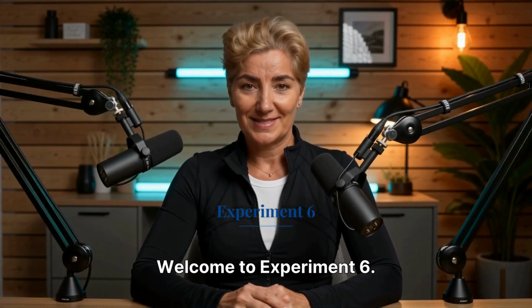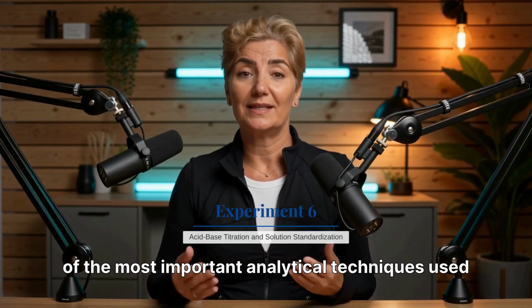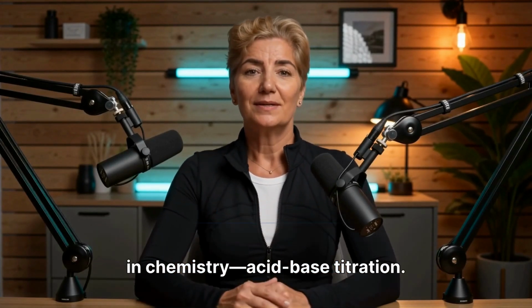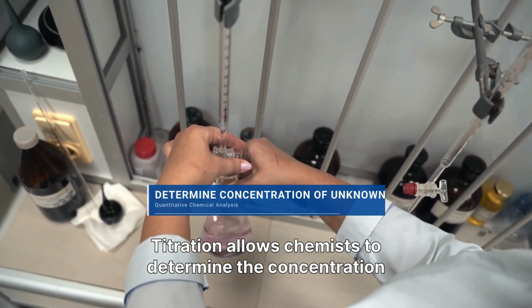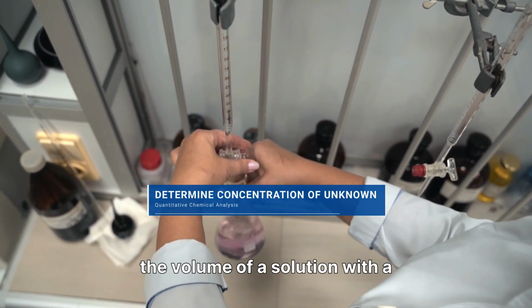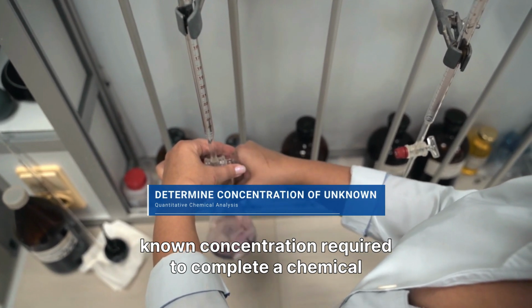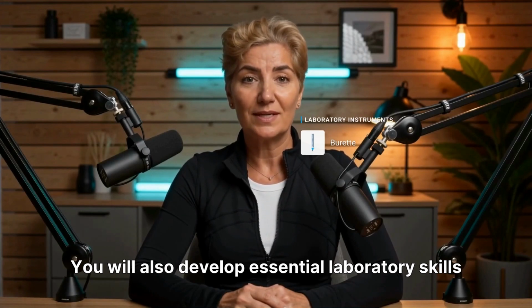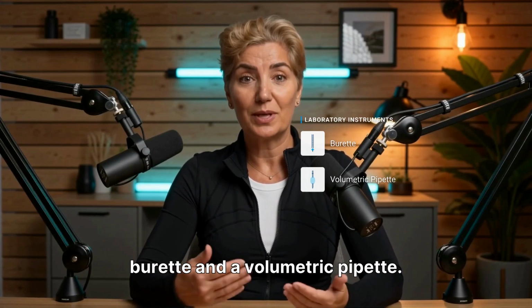Welcome to Experiment 6. In this experiment, you will learn one of the most important analytical techniques used in chemistry, acid-base titration. Titration allows chemists to determine the concentration of an unknown solution by carefully measuring the volume of a solution with the known concentration required to complete a chemical reaction. You will also develop essential laboratory skills by learning the proper use of a burette and a volumetric pipette.